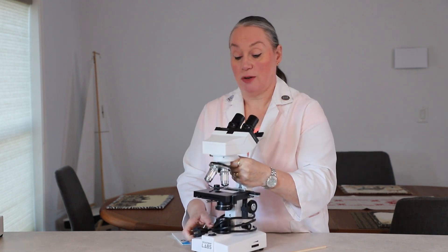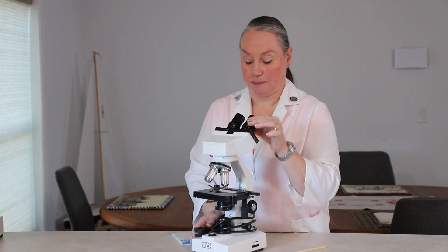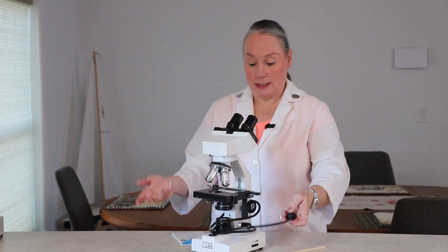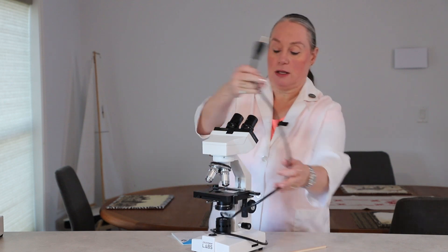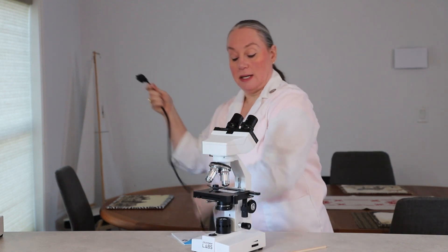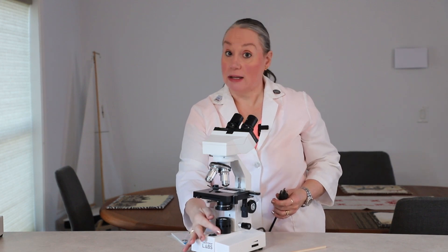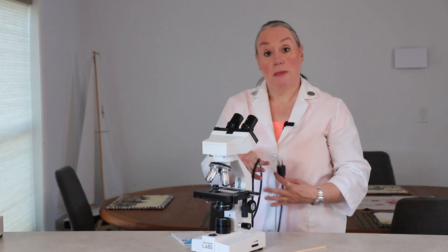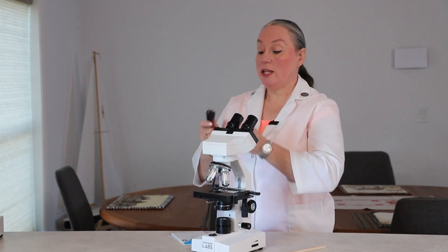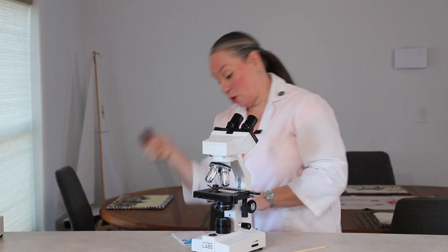Just as I demonstrated with this one, you want to hold it upright because the eyepiece might fall out. When getting it set up, you want to unwrap the cord. Depending on the light source, the light source could get hot, so you don't want to melt your cords — you want to take that all the way off. When you are plugging it in and unplugging it, you want to firmly grasp the cord.